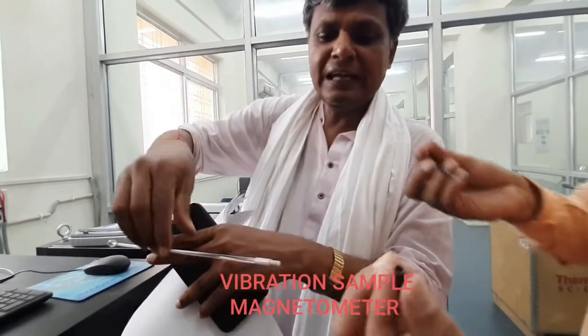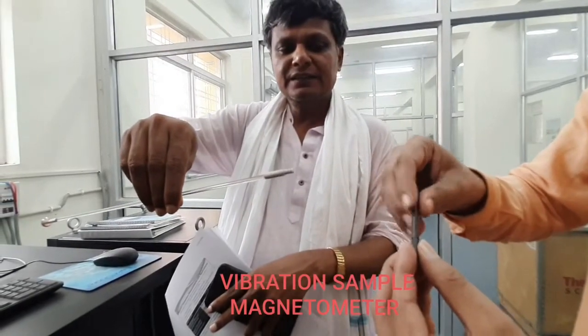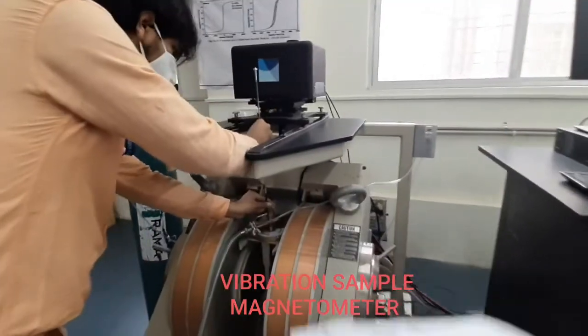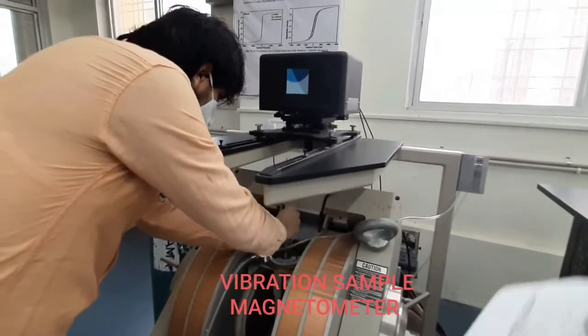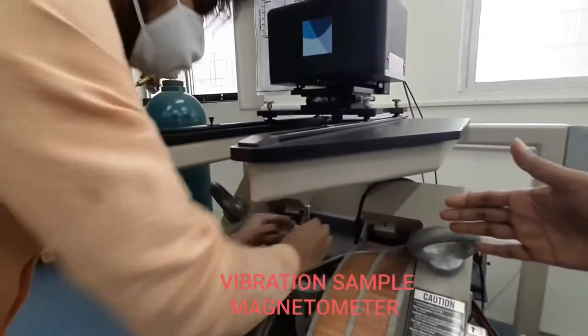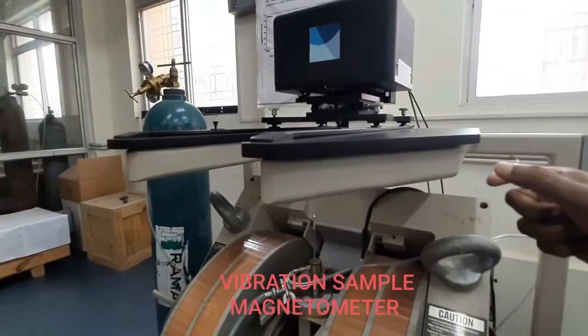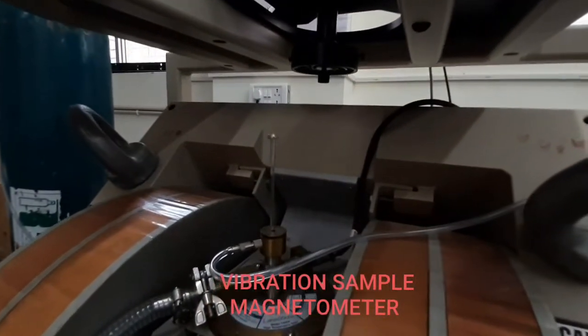And arrange it in this holder. We see here how this sample holder is to be arranged in this magnetometer, we can see here.